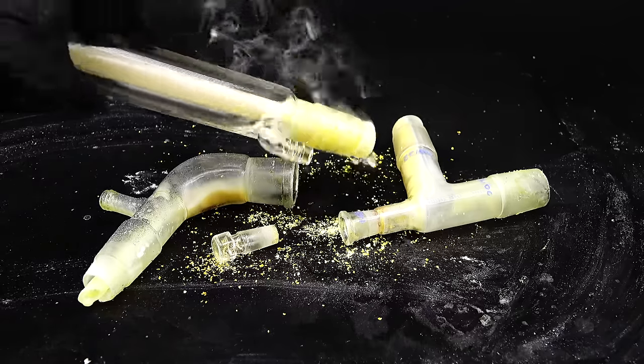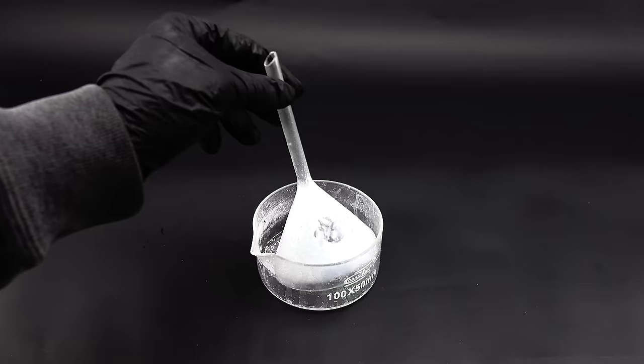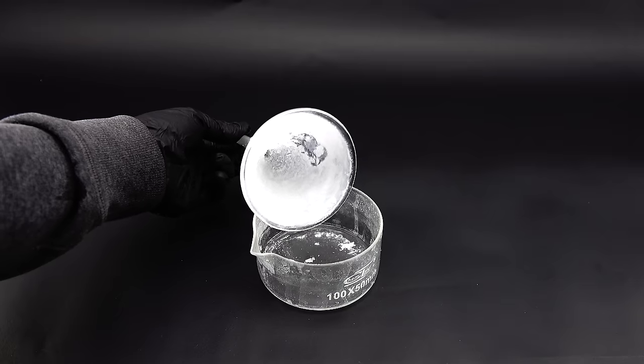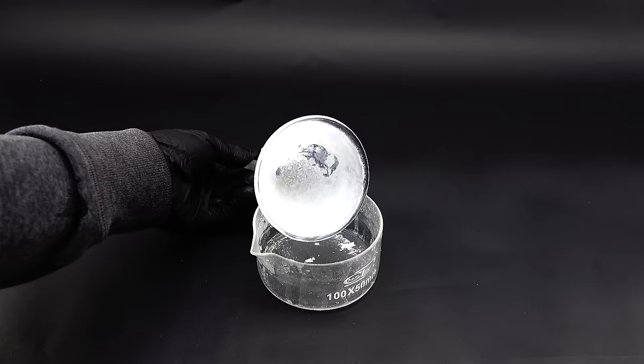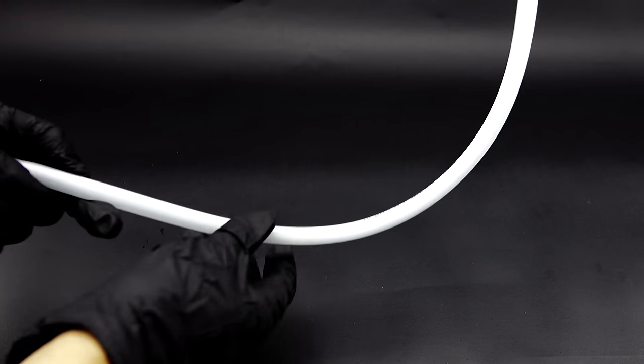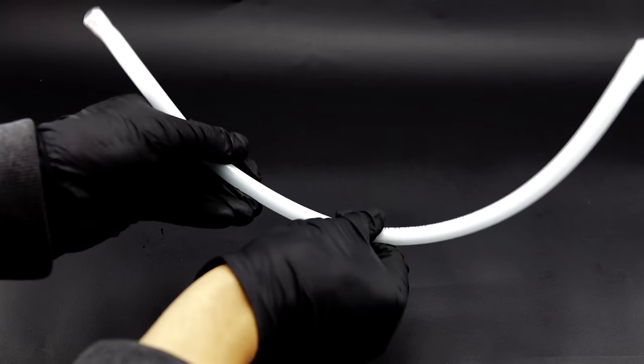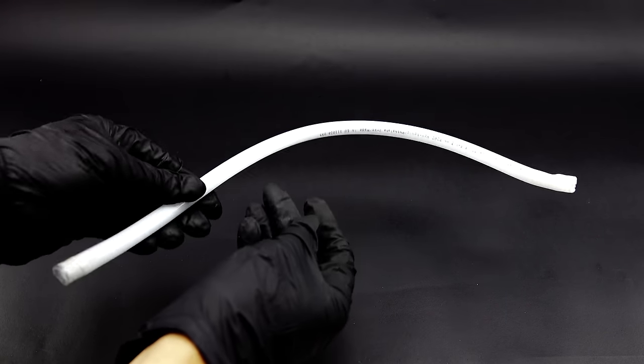I started to slowly take everything apart and figured out that the smoking stuff was actually the previously created aluminum chloride which got everywhere and was a pain to clean. Another fun thing was that my gas trap was now covered in a thick layer of silicon dioxide which I had to soak in a sodium hydroxide solution for days to even think about it coming off. All my gas tubes also suffered a ton of damage from the copious amounts of chlorine and I spent nearly two days just cleaning everything up.